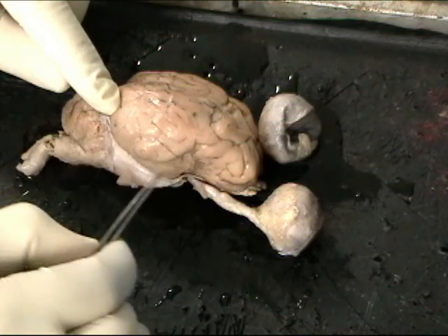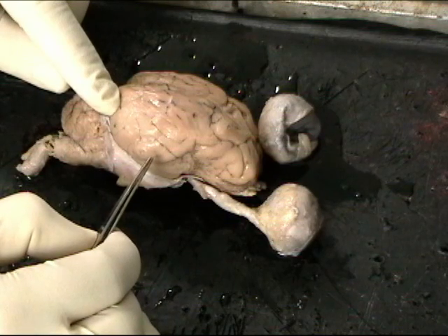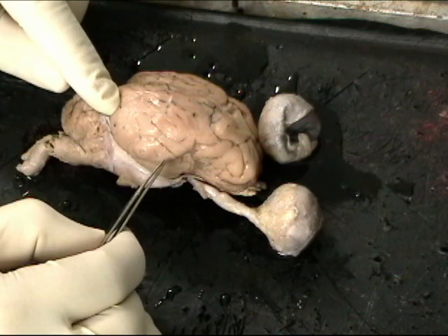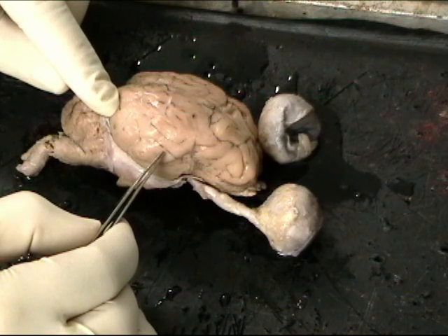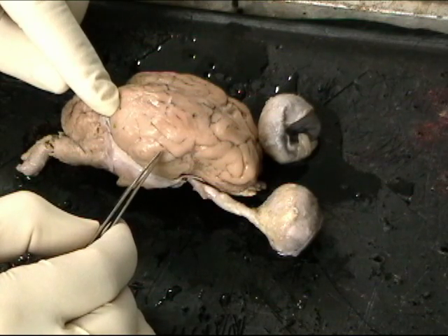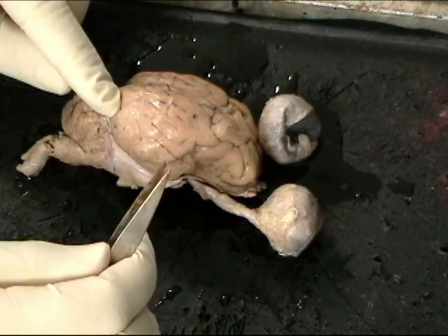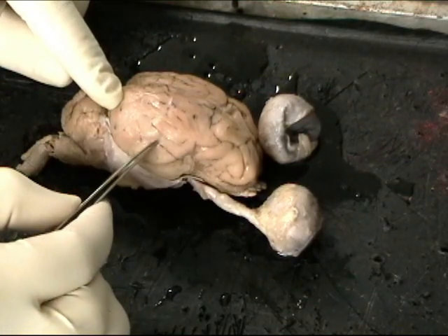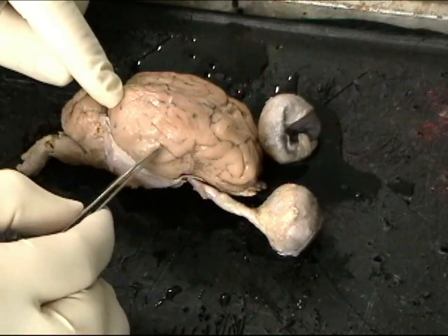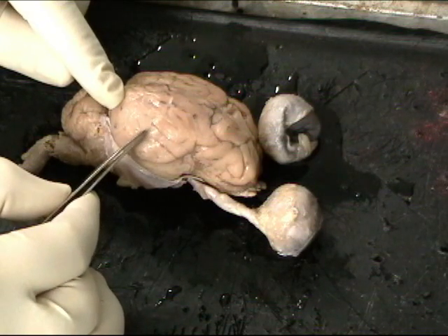The temporal lobe is also heavily associated with the memory system. And we'll say more about that as we look at other structures. Underneath the temporal lobe is a structure called the hippocampus, which is involved in memory function. In humans, not in sheep, the temporal lobe also contains an area that is associated with language comprehension.